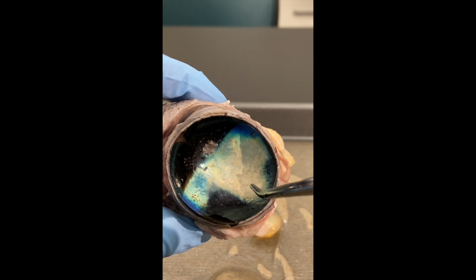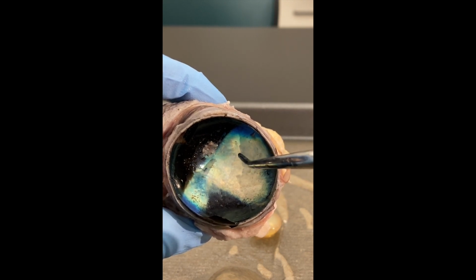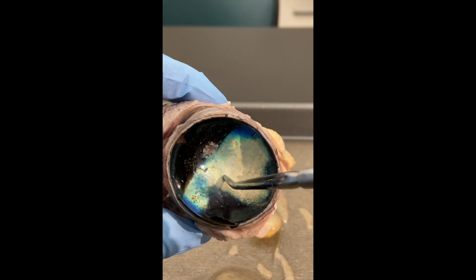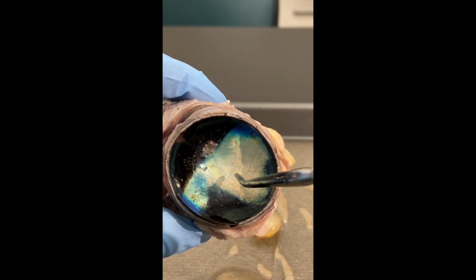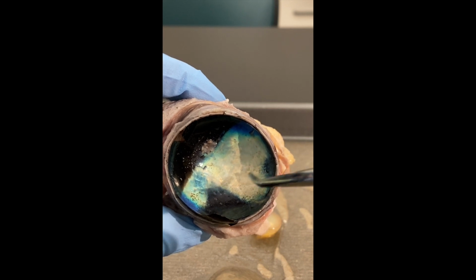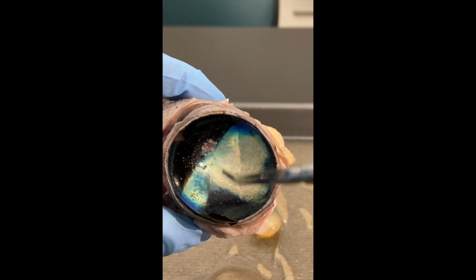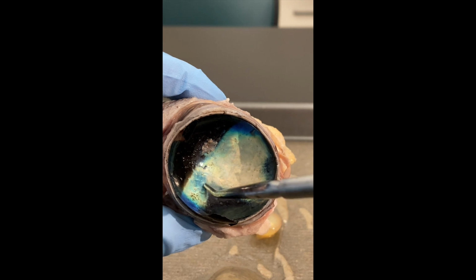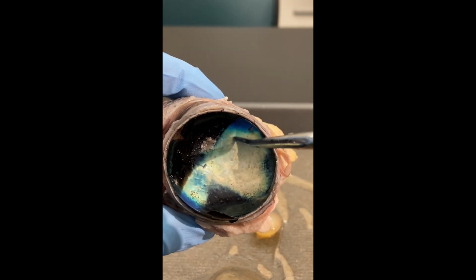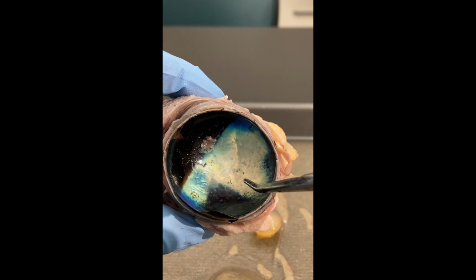That's why when you take a picture of your cat or your dog, you sometimes see this white or blue light shining back. That's the tapetum lucidum working like those mirrors. Ours, we don't have a tapetum lucidum. Instead, our pigmented layer of our retina is reddish brown, which is why we get red eye when light hits that and our pupil is dilated. So again, this beautiful blue iridescence that you see is called the tapetum lucidum.